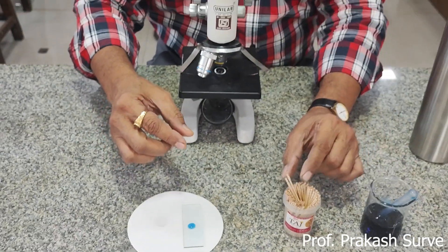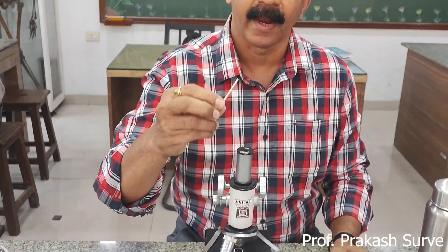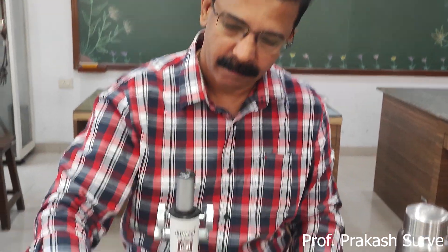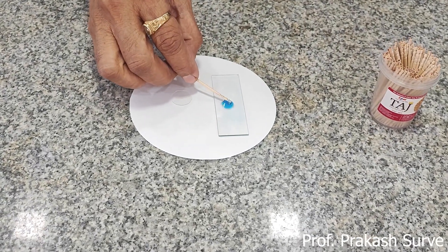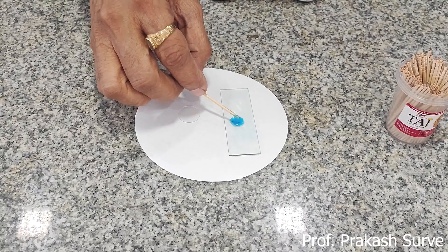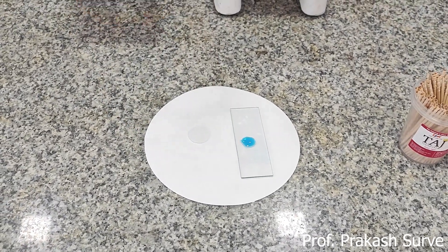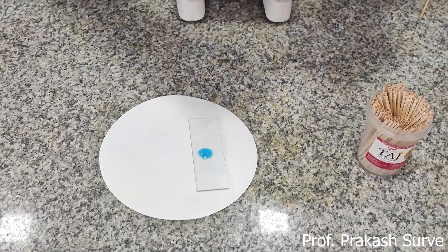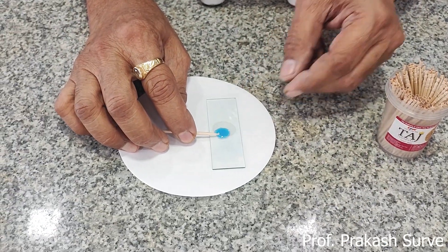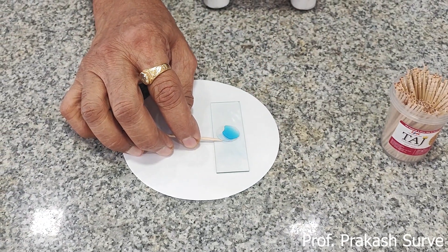First, rinse your mouth with water so that no dirt remains. Then, with the help of the blunt end of the toothpick, rub it on the inner side of the buccal cavity to collect the squamous epithelial cells. Transfer those cells onto the drop of methylene blue on the slide.